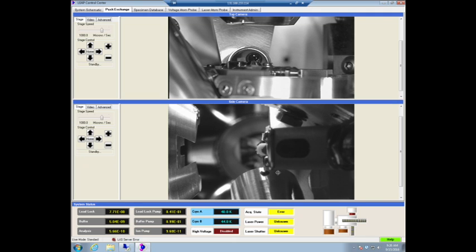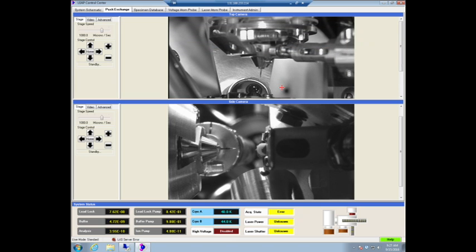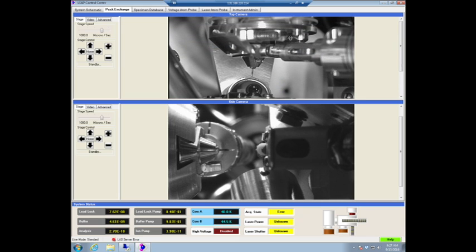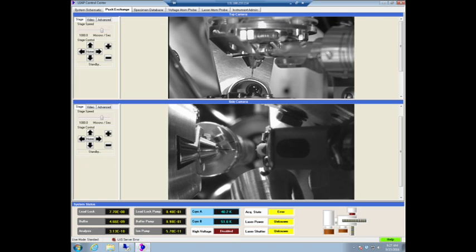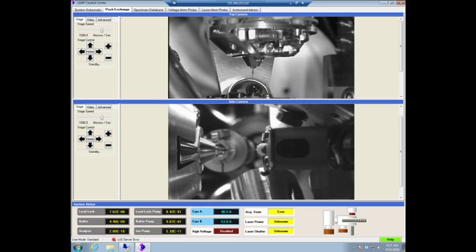Yeah. Stefan is actually doing the whole thing half blind, but you can see the specimen coming in, and he's locking it on now. And at the back here, you've got a little latch, and that latch actually secures the sample. So you need to twist the sample holder in the other direction. And you can see it latched on now, and then you can pull. It's fine, you can pull, Stefan, and the sample is in. Okay? So it's fairly easy, and it should always go without force.